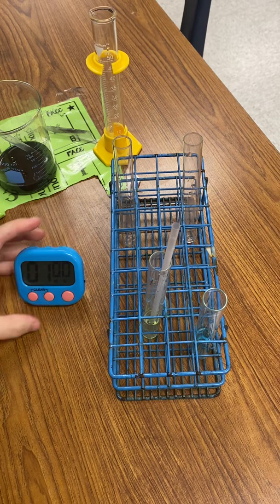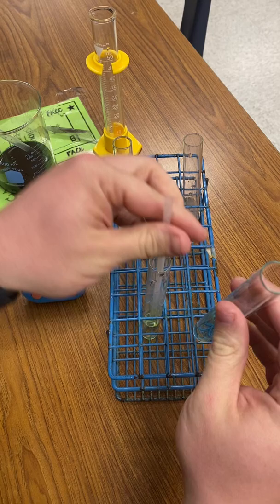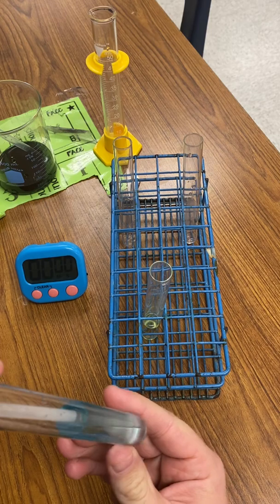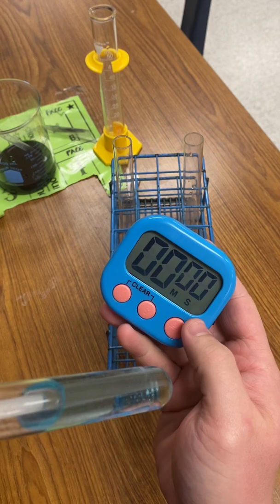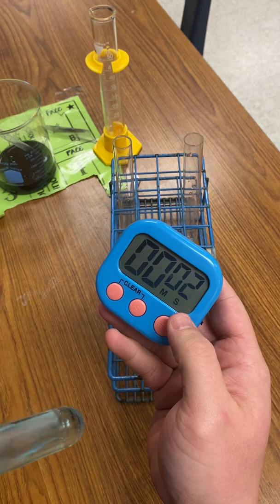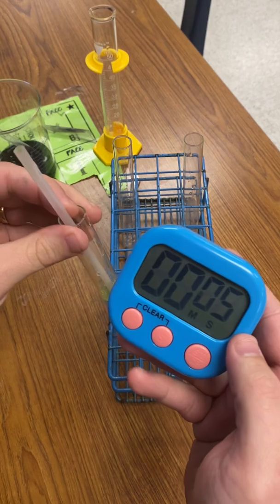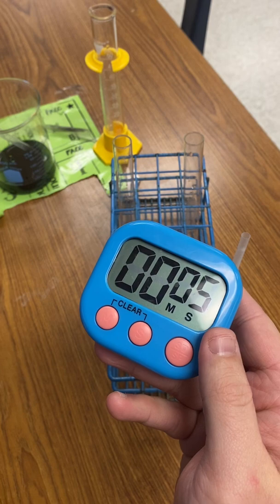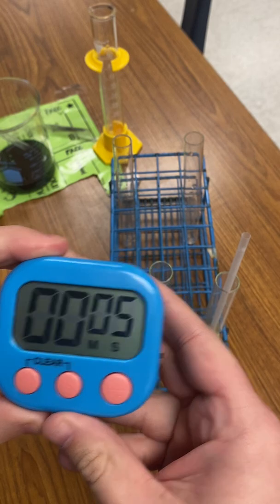All right, so that's a minute. Stop, clear it. Now we're gonna do the exact same thing. Straw in here, right? And we're gonna blow and time. So, here we go. So that was probably about 4, maybe even a little sooner, but whew, I gotta get that oxygen now. So I'm gonna get that new time and I will record that time in there.